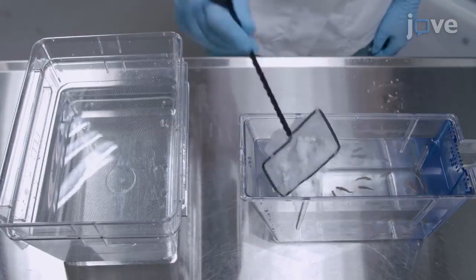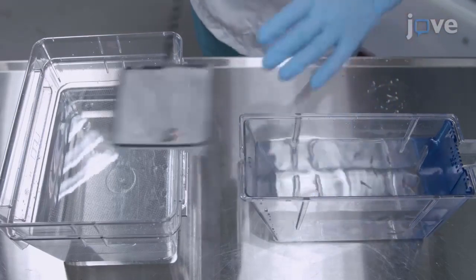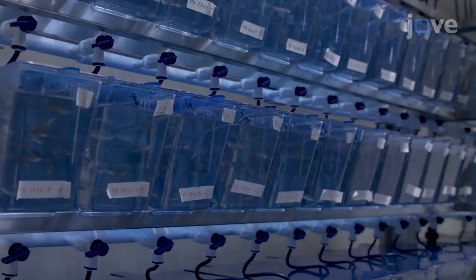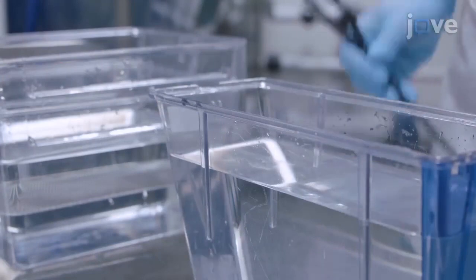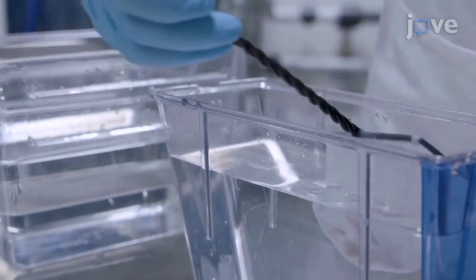To begin, place 2–5 adult male zebrafish and 3–5 adult female zebrafish into mating tanks overnight. In the morning, turn on the light, as breeding is induced by the automatic dark and subsequent light cycle. To avoid handling stress to the animals, allow them to rest for 2 weeks before using the same individuals for breeding again.